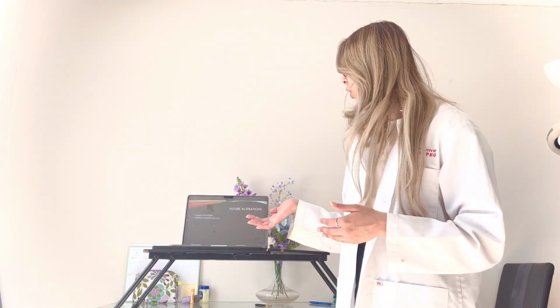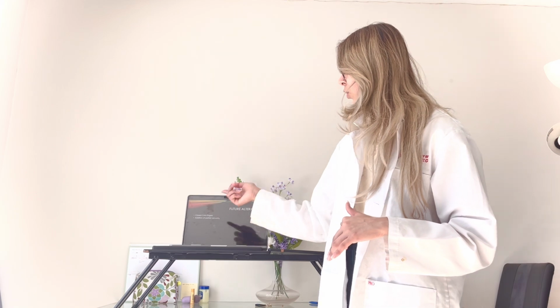For future alterations, I would like to suggest some changes to the sublimation portion of the reaction, like a closed cold finger, or the addition of partial vacuums. After discussing with the instructor, I found that the closed cold finger actually has a lower yield than needed, and it could be a worse alteration, but that has to be determined.